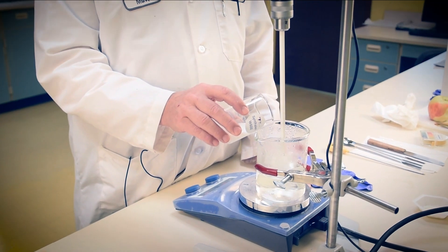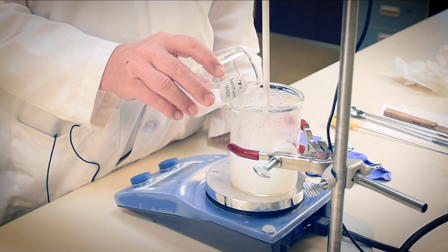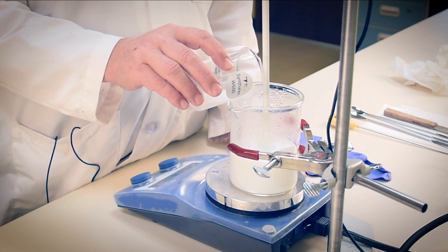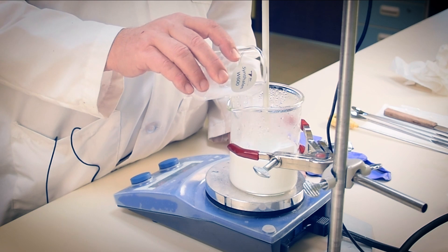As you can see, this 30% anionic acrylate solution is opaque at start but will clear as we bring our pH closer to neutral. Our surfactants and dilute sodium hydroxide will be used for that. We'll gently heat this to 50 degrees Celsius for faster incorporation of surfactants.